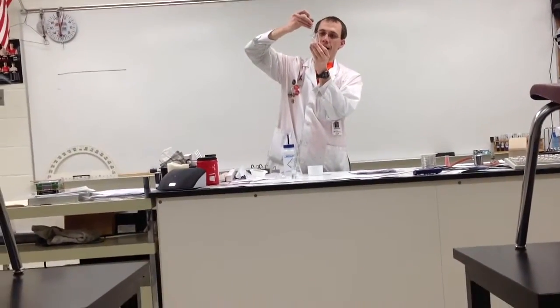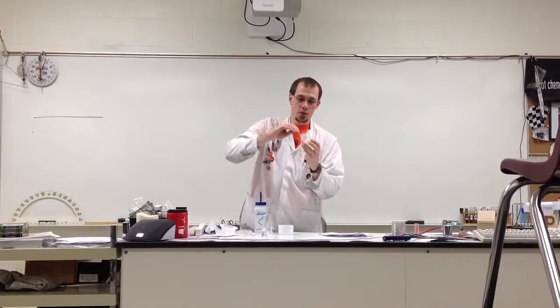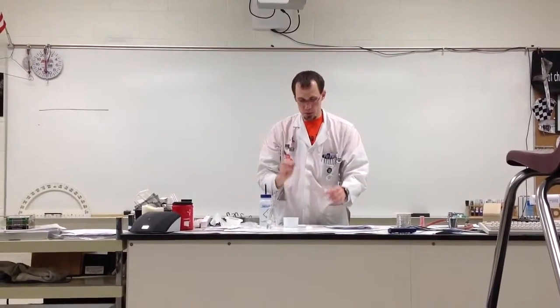Put it around enough so that you can get all of that off. Because your copper is now in solution, you want to wring out the filter paper by rolling your stirring rod over the side of the beaker as best you can. Some of you might see a little bit of paper fall apart into the solution — that's not the end of the world. Then after you're done with that, you can just put that onto a paper towel, and your solution should be all green now.